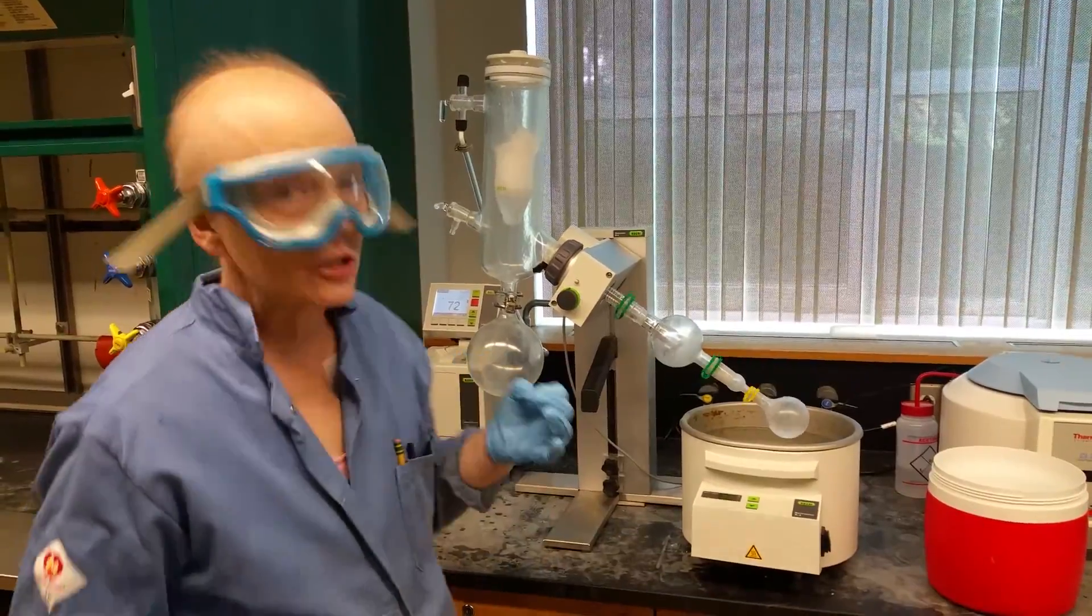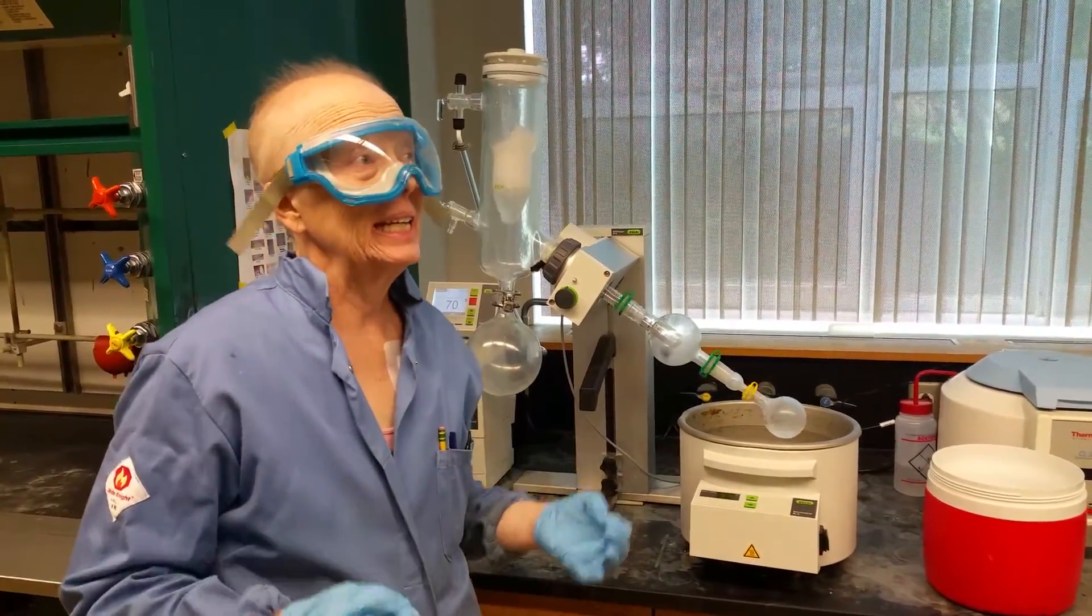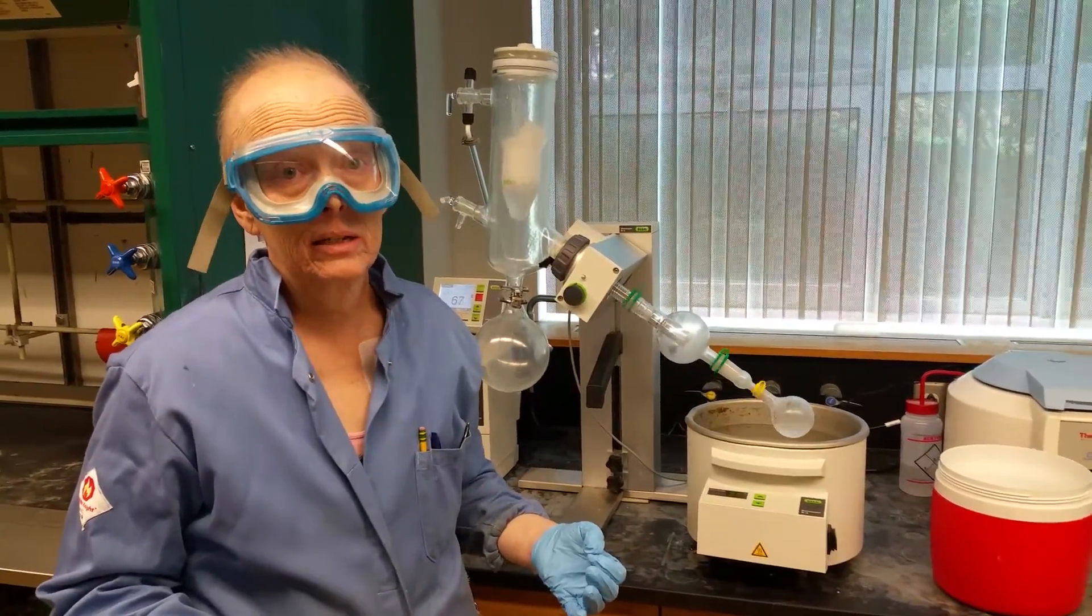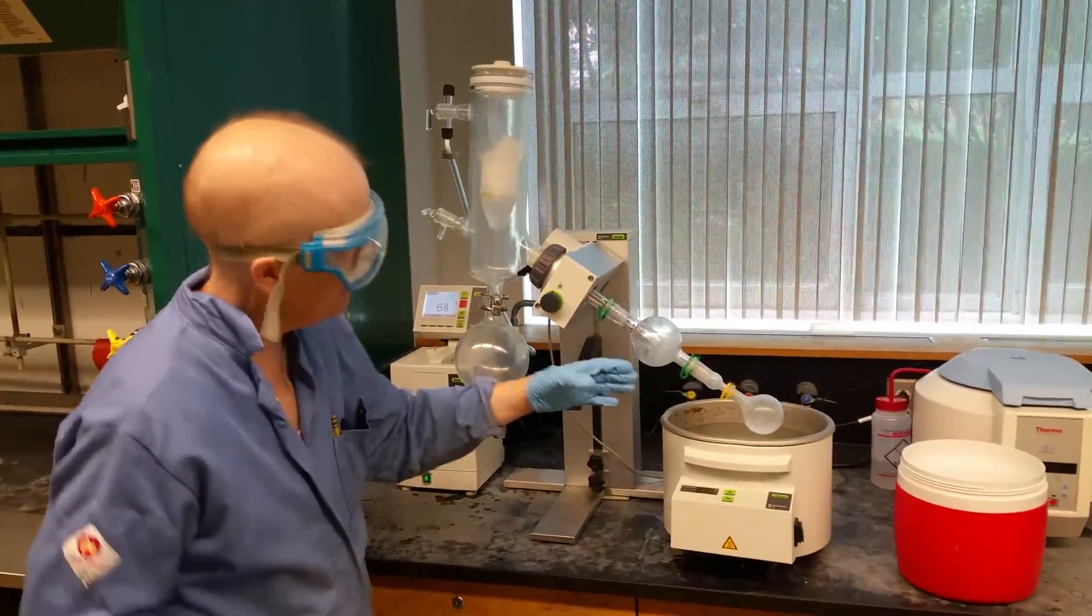If it's 760 torr and it's weighing down on your sample, it's harder for the molecules to lift off and become vapor. So you reduce the pressure. When you reduce the pressure, there's far fewer molecules weighing down on the sample. This means the molecules become much more volatile and they lift off at a much higher rate. So that means you can distill or you can vaporize at a much lower temperature.